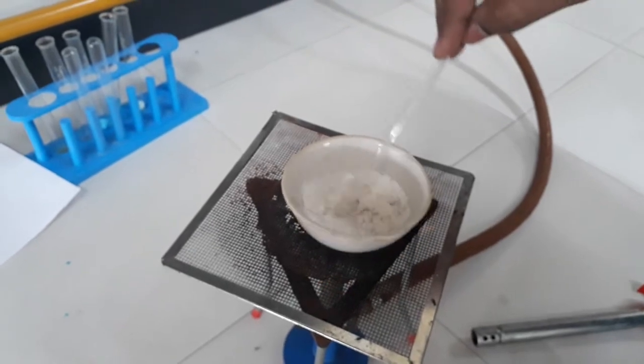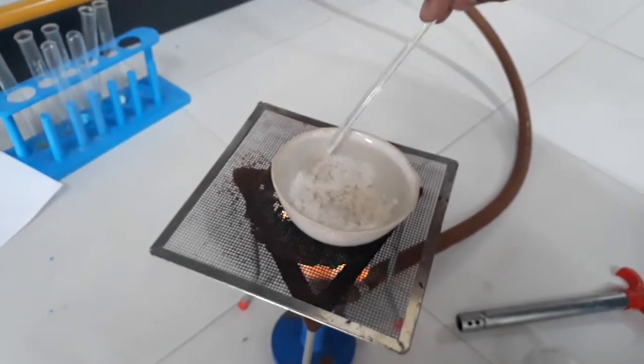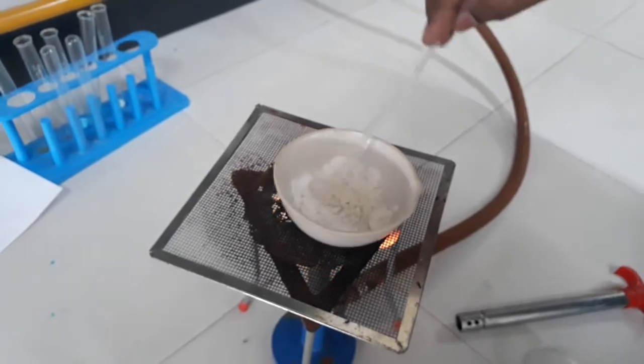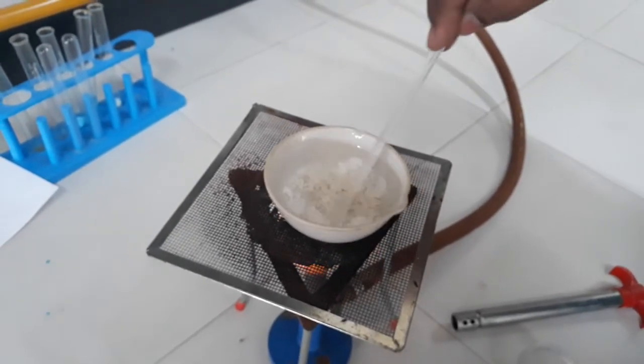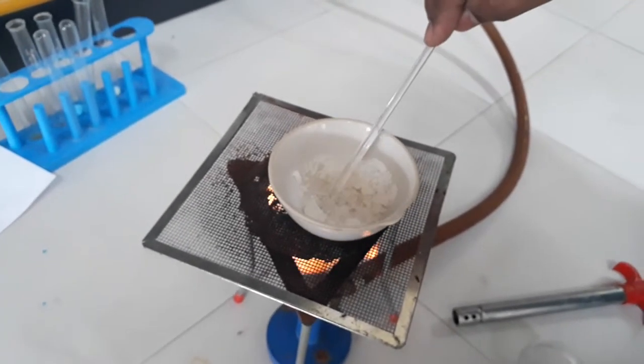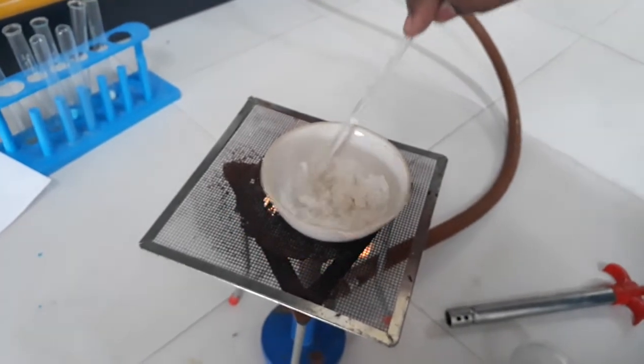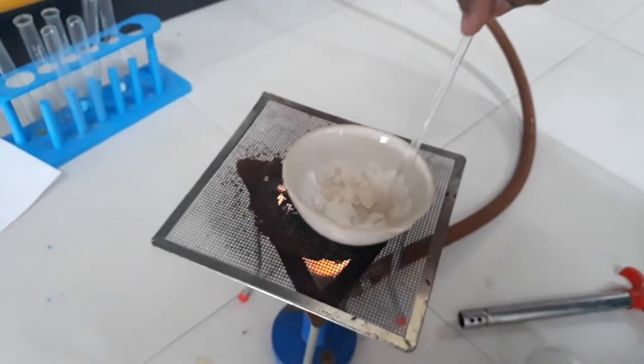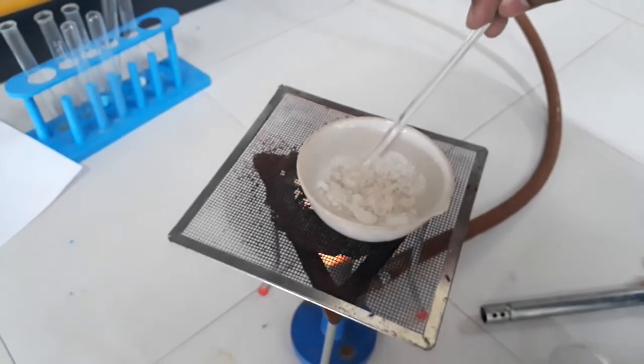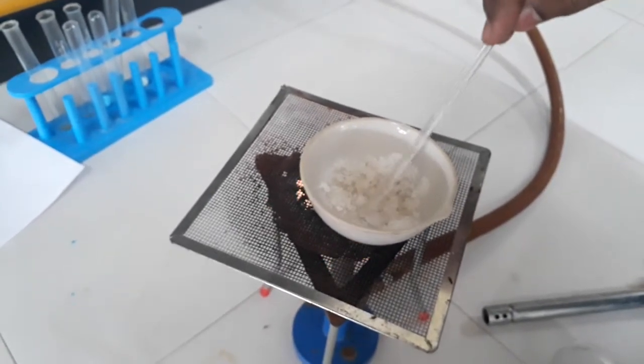You can see afterwards a lot of water of crystallization can be seen. Initially it was purely in solid state, now you can see it is converted to liquid state slowly, and this is nothing but due to water of crystallization.